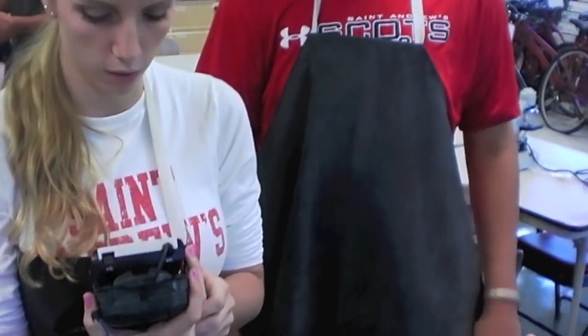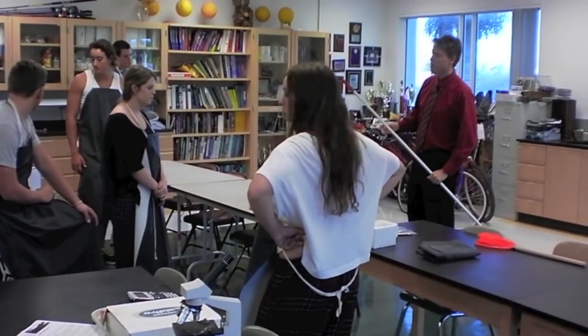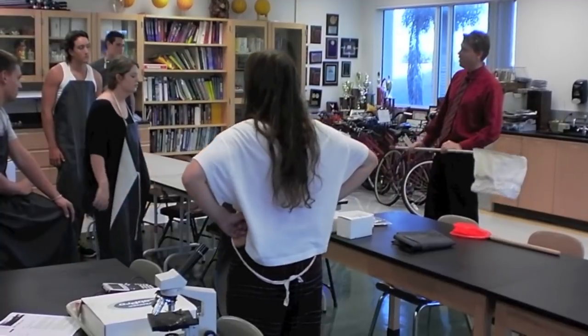Once we do all of these tests, the students will come up with the water quality index, which is a term used throughout the country to actually determine what the overall health is of the pond. Once they finish with that, they'll have a really good understanding of how environmental engineers and scientists actually do these studies in the real world and what these studies can mean.